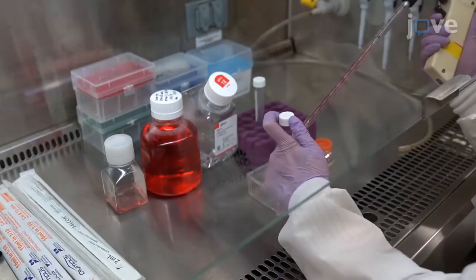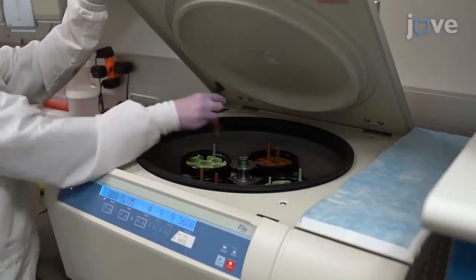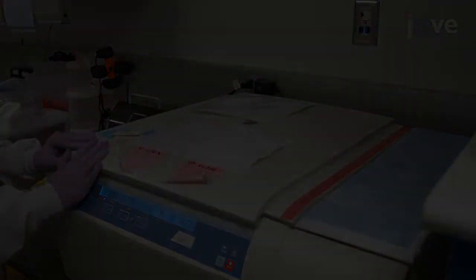Transfer this cell suspension to a 15ml centrifuge tube and centrifuge at 200 times G and at 4 degrees Celsius for 5 minutes.